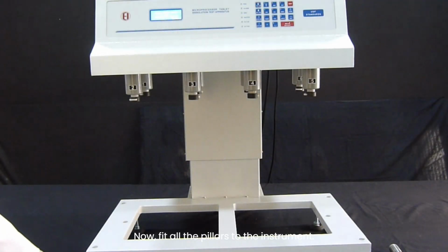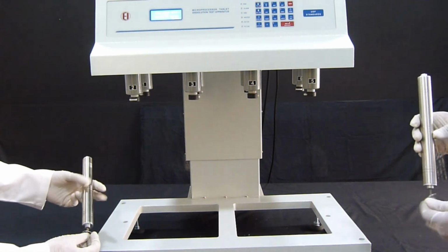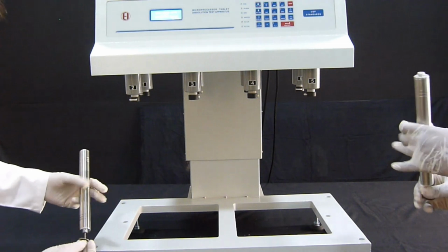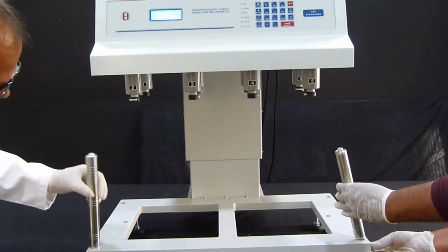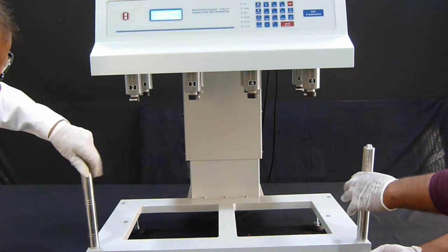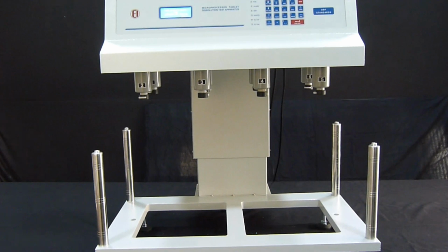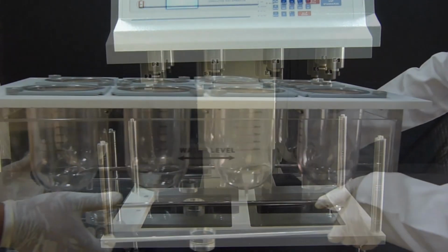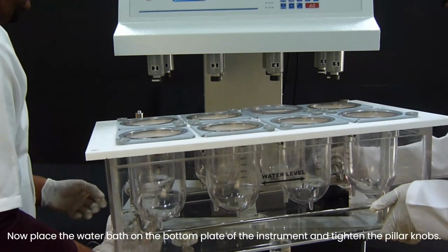Now, fit all the pillars to the instrument. Now place the water bath on the bottom plate of the instrument and tighten the pillar knobs.